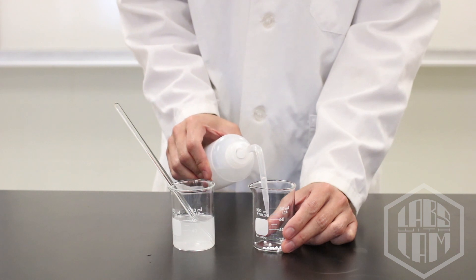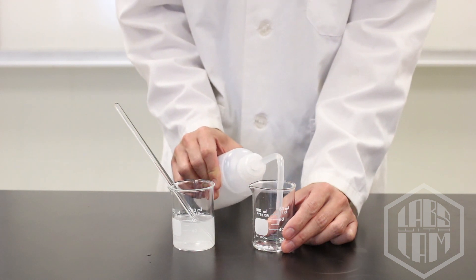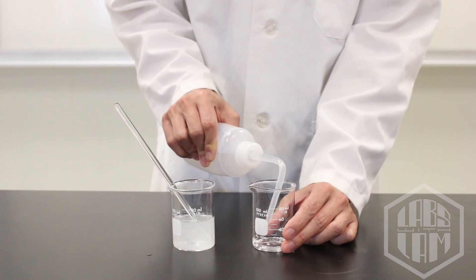Just a quick note: I wanted you to notice that the calcium chloride is way more soluble, so I don't have to add as much water.